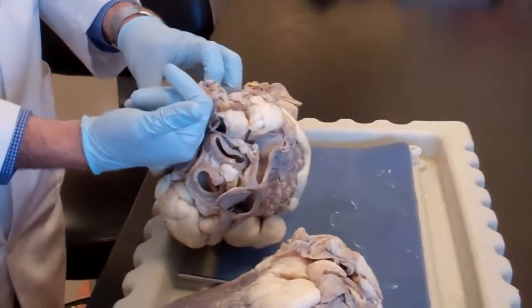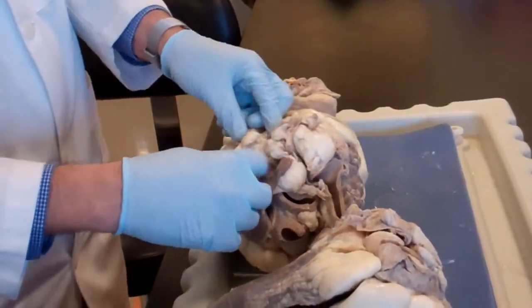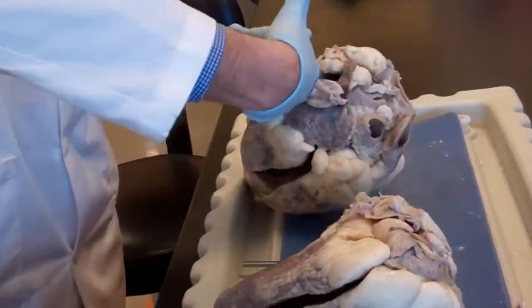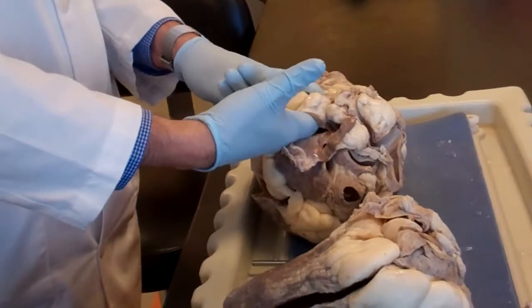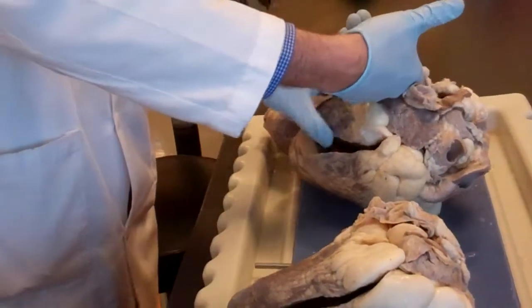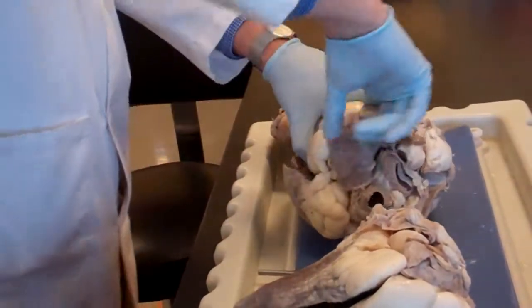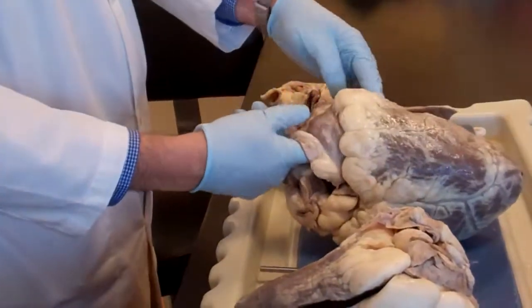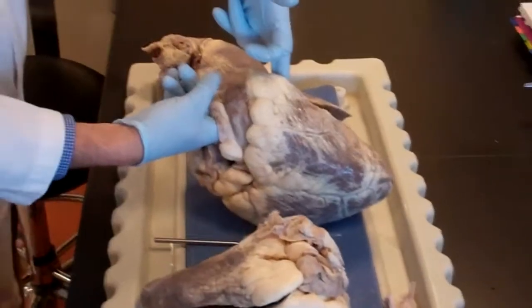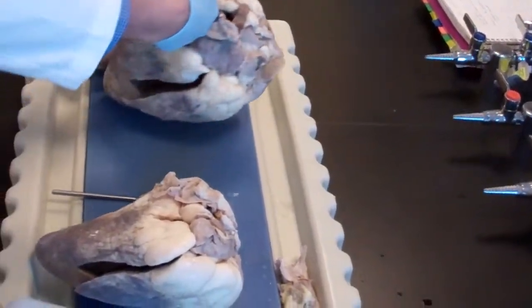Now, I'm going to turn my fingers around and go out. I'm going to show that one too. And go out into veins, okay? And this is one of the veins here, and this is the other one. So this is superior and inferior vena cava. Okay? See? They're right there. And I am in the right ventricle, right atrium. So I didn't make, I'm right here. You see? I know. You don't believe me. I know. There's no boo-boo. Okay? And here. Okay? And I'm coming out superior inferior vena cava.